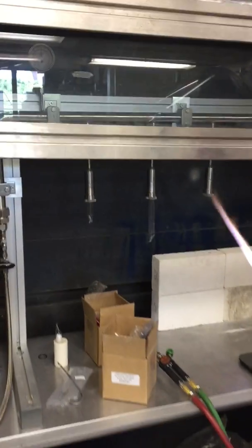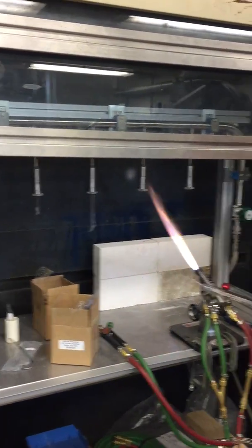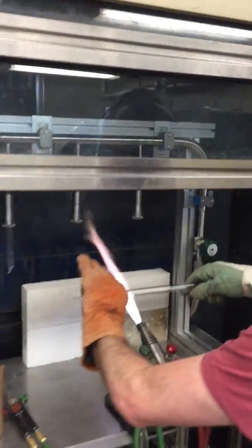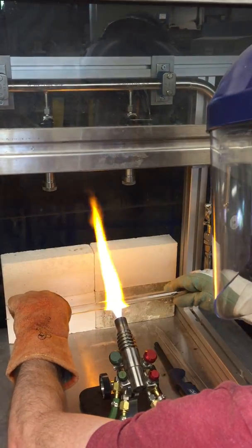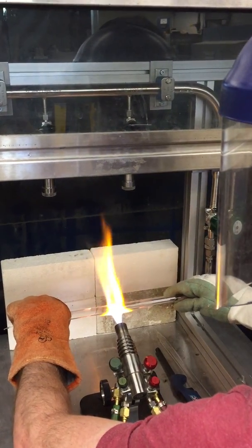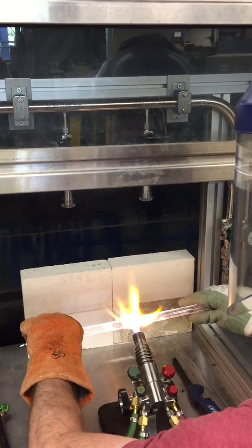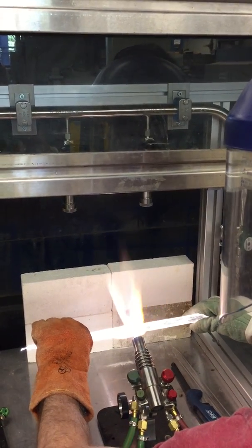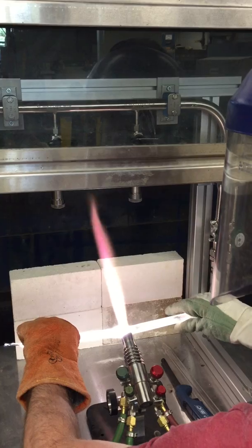So that when they're in here, you don't have to heat it so much to pinch it off the other half. Because if you're trying to do it with a hand torch, it takes a long time to neck down something this diameter. So neck down the other side. You also don't want to expose your samples in there to this high heat, so you want to make sure they're away from the area. You're trying to give this a neck that's pretty small so it'll finish quick with the hand torch — maybe like a centimeter or less.